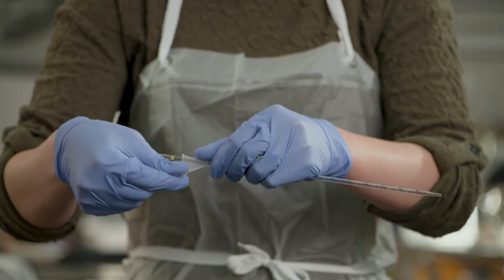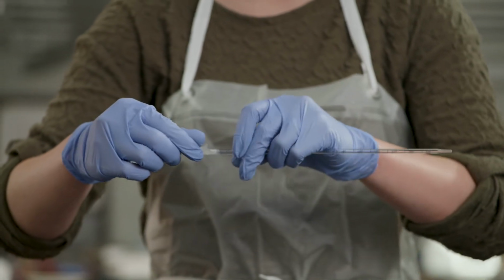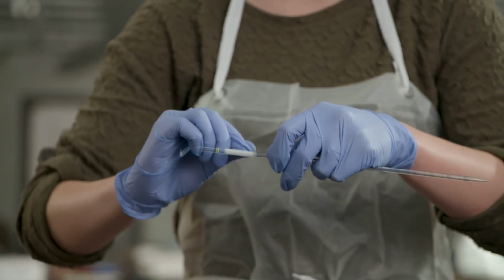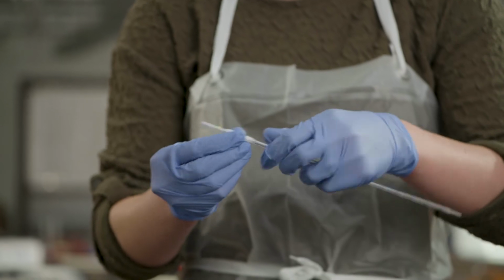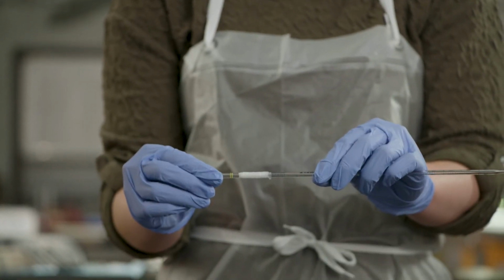Respirometer assembly starts with creating a tight seal between the pipette and the rubber stopper. Take your strip of parafilm, place it approximately 1.5 inches from the blunt end of the pipette, and tightly wrap it around the pipette. Parafilm is stretchy, so gently tugging on the parafilm as you wrap it will help the film adhere to the glass.